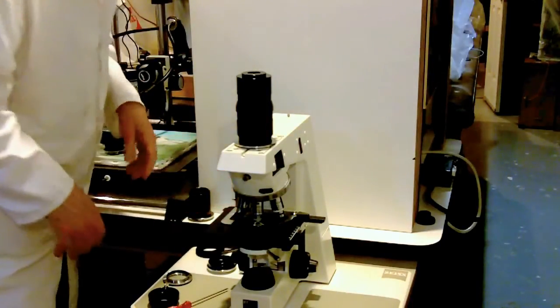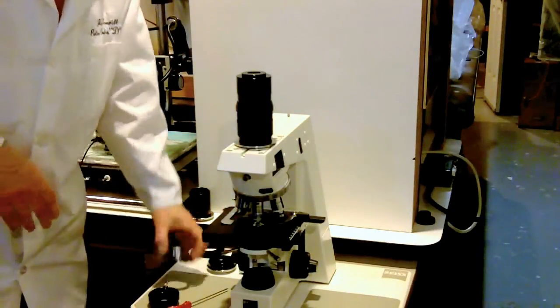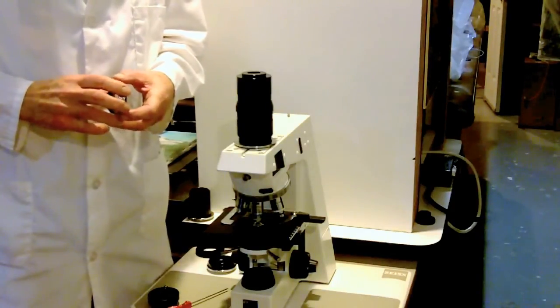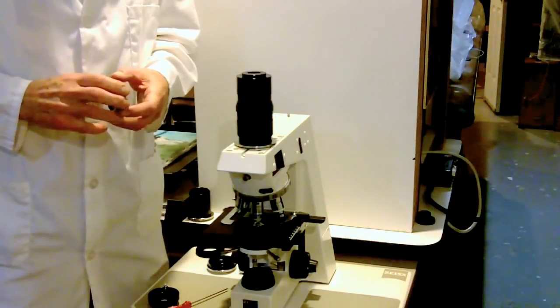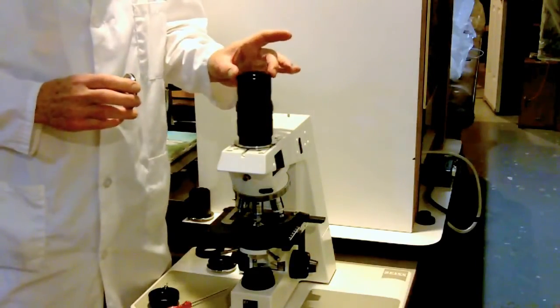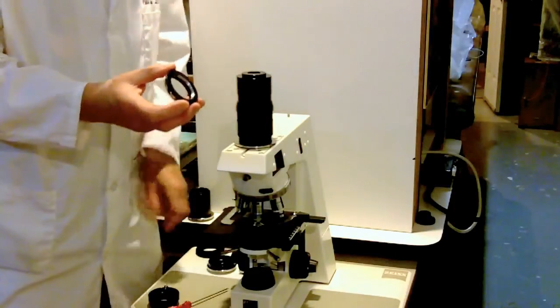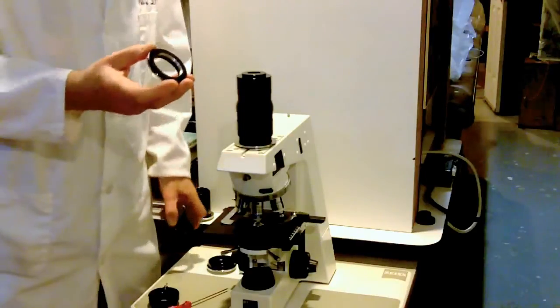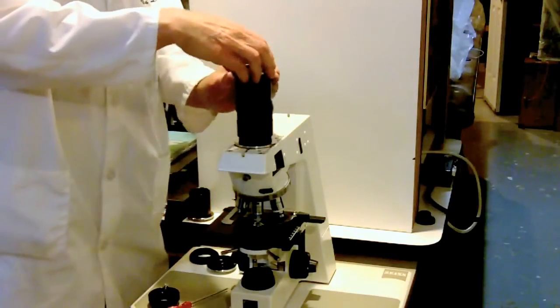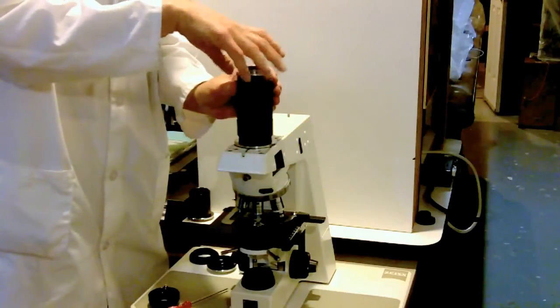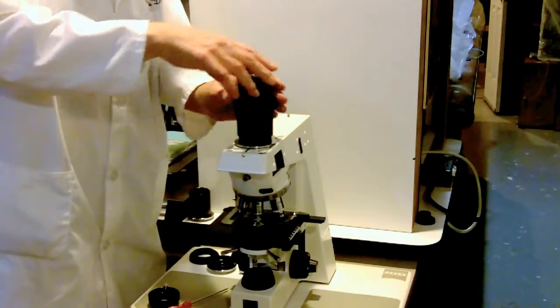The so-called large format cameras such as cameras that are designed to hold film, where the film frame for 35mm is 24x36 with a 43mm diagonal, or any of the popular DSLR or MILC cameras that are on the market with interchangeable lenses. So the first thing you need to put on to the 2x is the so-called T-mount. Here's a Canon T-mount, here's a Leica T-mount from my Leica film camera. We simply thread this on to this M42 thread.